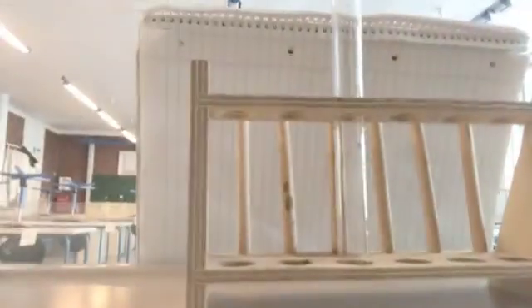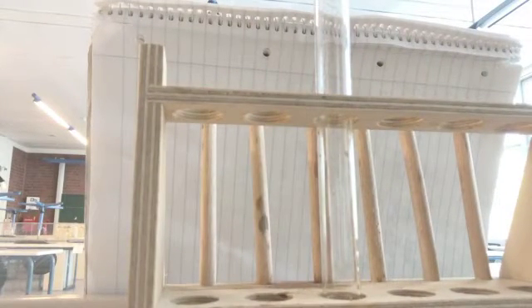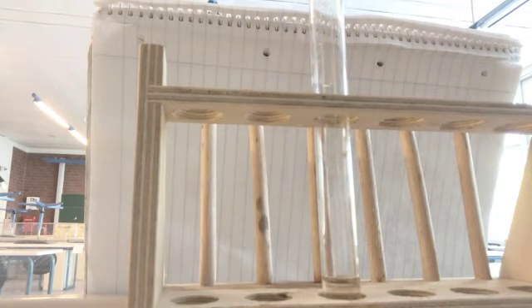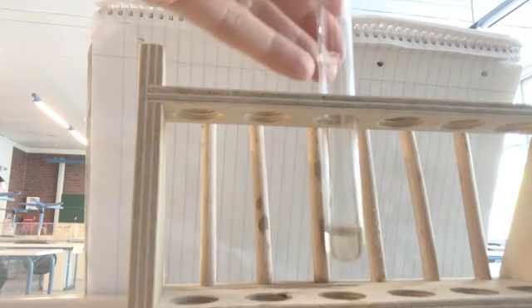So I'm going to set up our little setup here. I'm going to start out with about, again, 10 to 20 drops of hydrochloric acid. So I'm going to go kind of just a little bit of a squirt there. That way we can see that. I'm just going to put a certain amount in there so you can see that we've got a little bit of a clear solution there. And now I'm going to add some universal indicator. And when I add this universal indicator, you'll see a color change showing me that this is an acid.